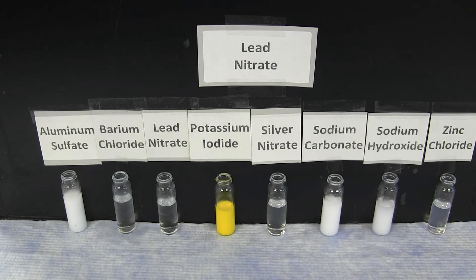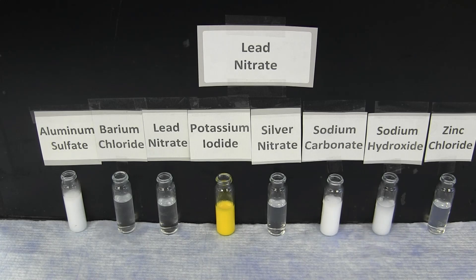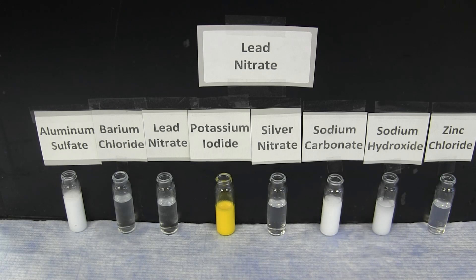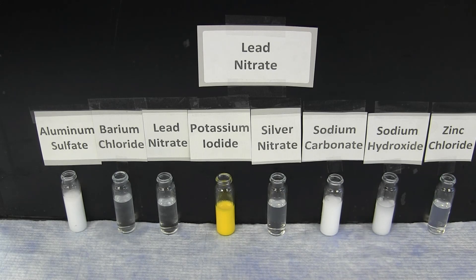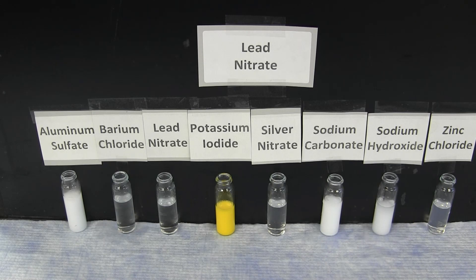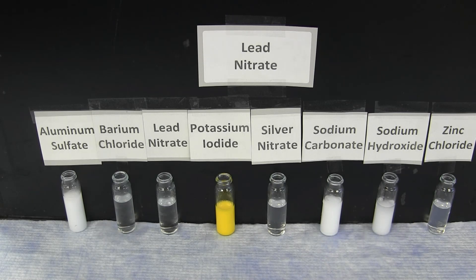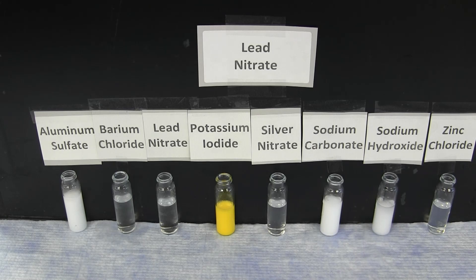Lead nitrate forms a brilliant yellow precipitate with potassium iodide, and white precipitates with aluminum sulfate, sodium carbonate, and sodium hydroxide. There is no reaction with barium chloride, silver nitrate, or zinc chloride.